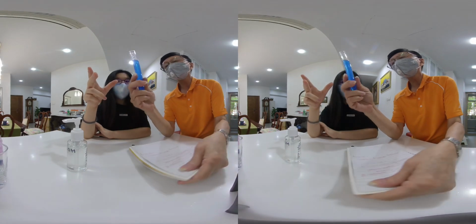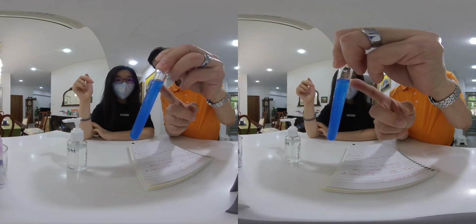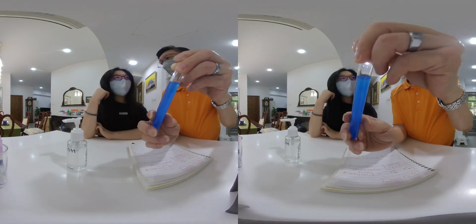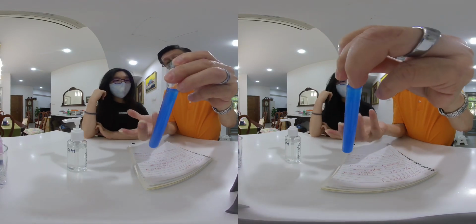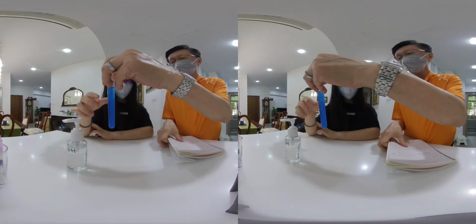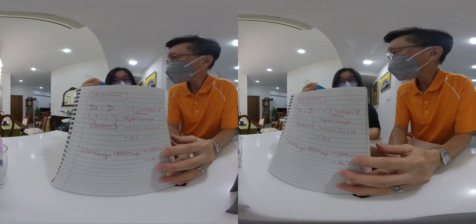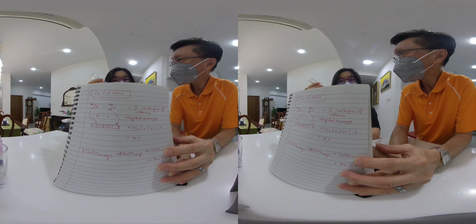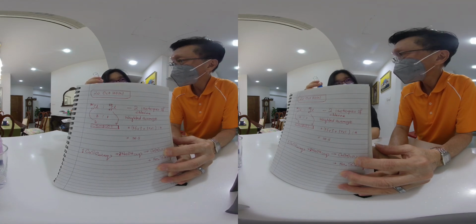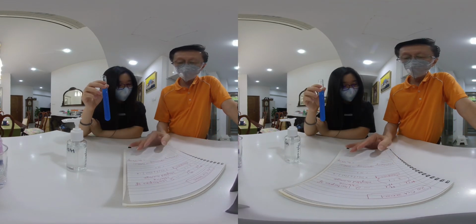So, although the PPT is suspended in the colorless solution of sodium sulfate, finally there is no blue color in the solution. The blue color has been extracted out as the insoluble copper 2 hydroxide, which is Cu(OH)2. So this is what is important.